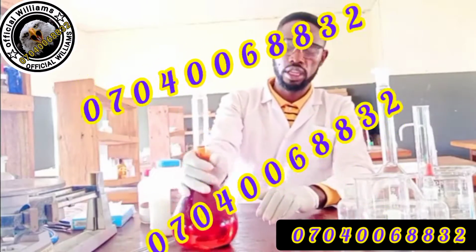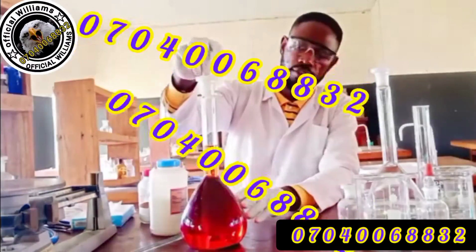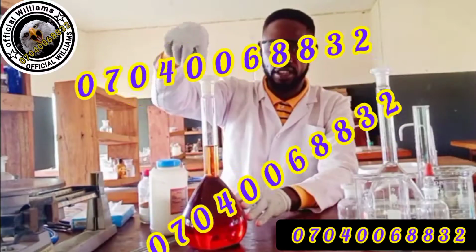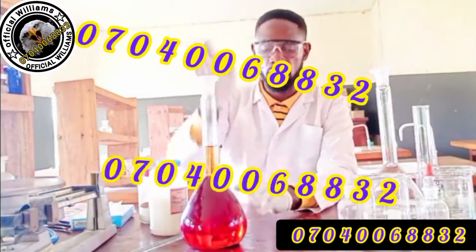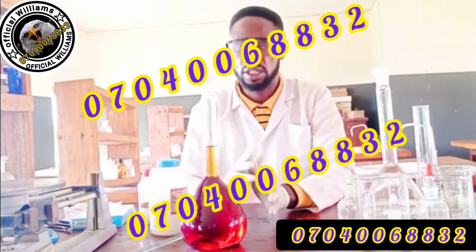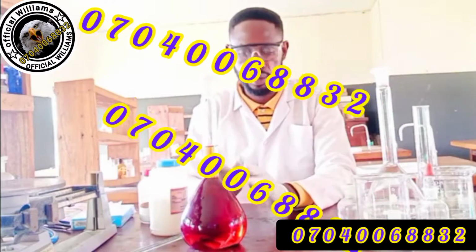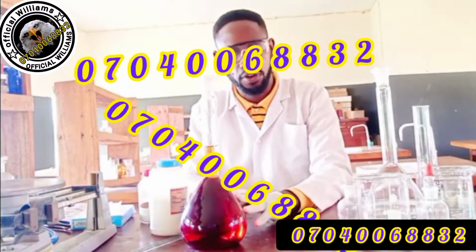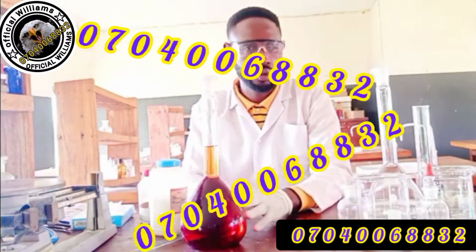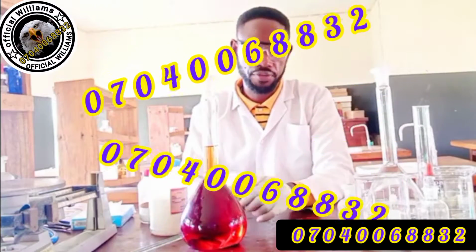This is our solution A, and remember I'm going to discard this immediately after this video. Otherwise, if I keep this for just 2 days, the whole cork that you see that is very neat now will all turn reddish brown. Iodine is very stubborn and stains everything that comes its way. It's volatile, it's reactive just like halogens, of course. So be careful, and I say again, prepare this very early in the morning on the exam day. Don't prepare this a day before, 2 days before, because definitely even consecutive titrations vary so much.